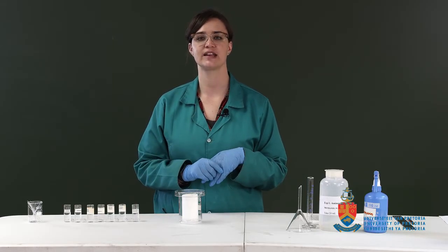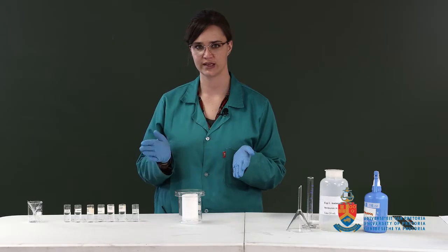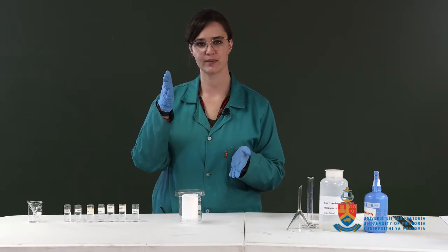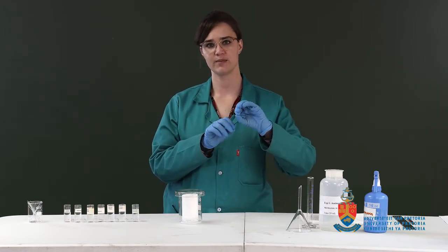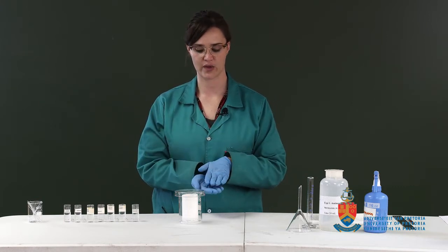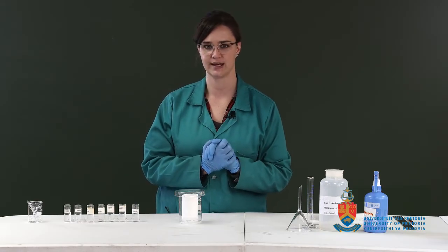So it will spend either more time in the stationary phase on the paper or in the mobile phase, which is the eluent. So as the eluent rolls up the paper chromatogram, your amino acids are going to change from being dissolved in the paper chromatogram to being dissolved in the eluent. And this is how they are brought up along the paper chromatogram, which you will see at a later stage.